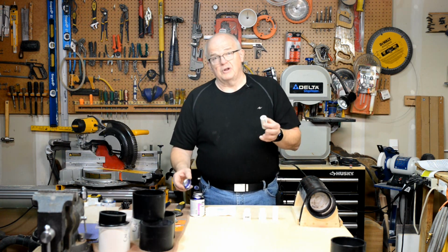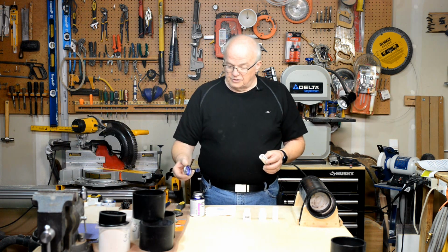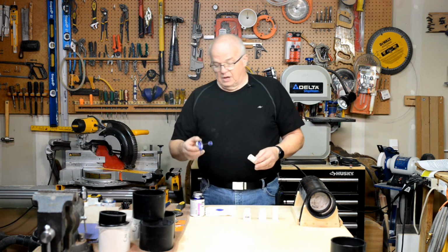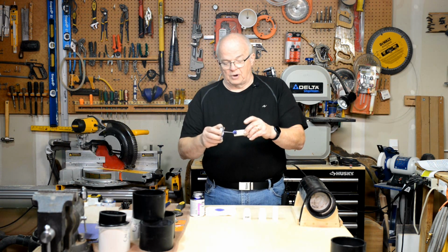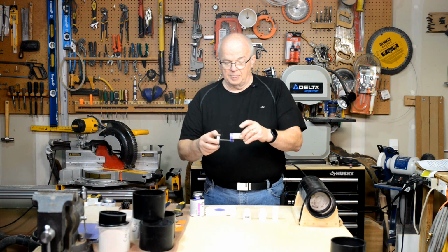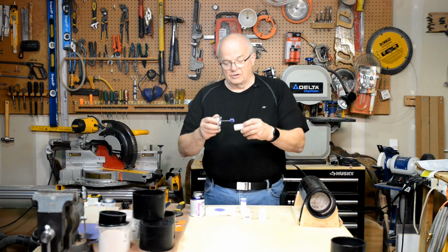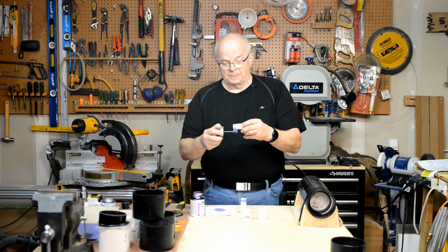Now, anybody that's worked with this primer before knows that it gets all over the place. So when I take the primer out, even though it's not dripping, I'll touch it against a paper towel. That will help me control the primer. You're going to want to prime about maybe 3/4 of an inch. You don't want to go up too far. Okay, there's that one. And this one also, again making sure that you're going opposite the end that has the bevel.